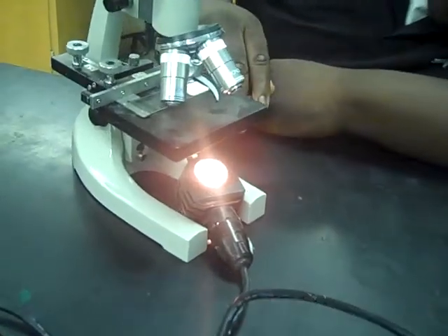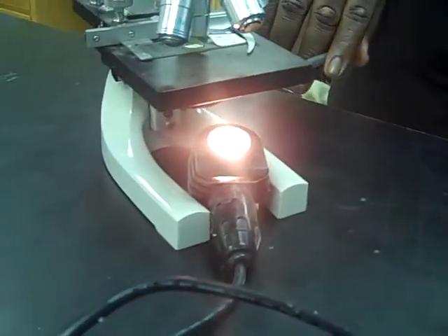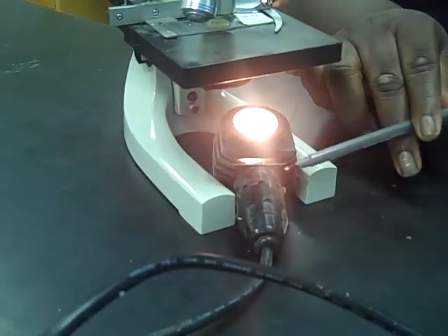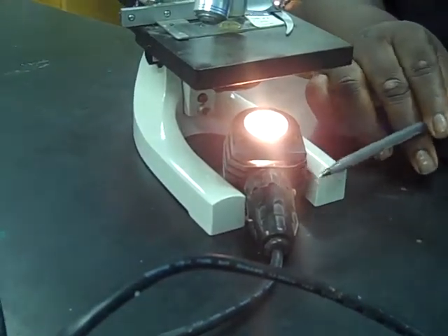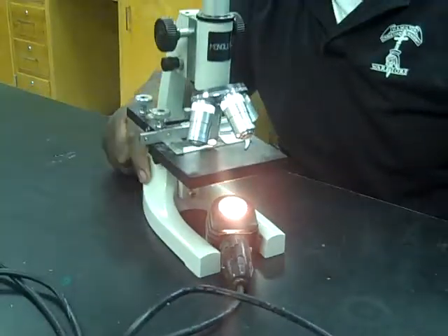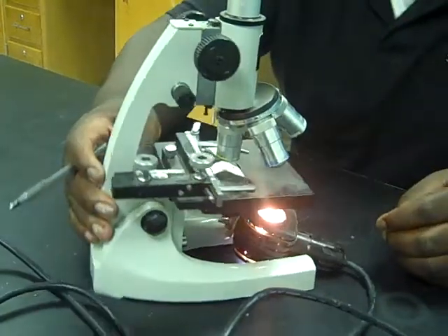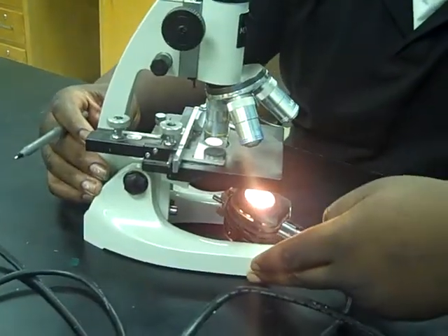And under here, it's kind of hard to see, but here's the diaphragm, also known as the iris. They also have the illuminator right here, which is also the light source. Then on this side over here, this is the arm, and at the bottom you have the base.